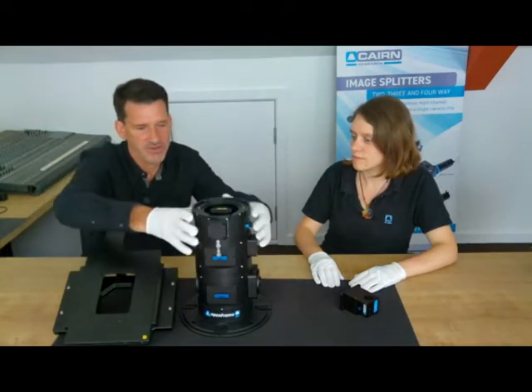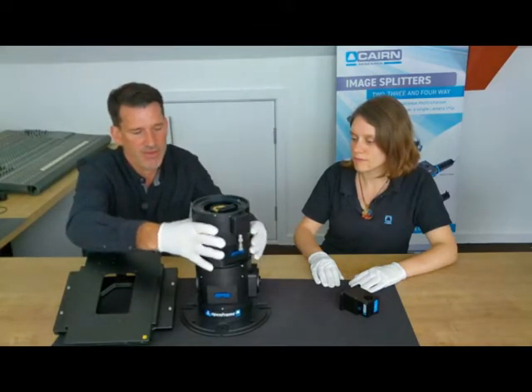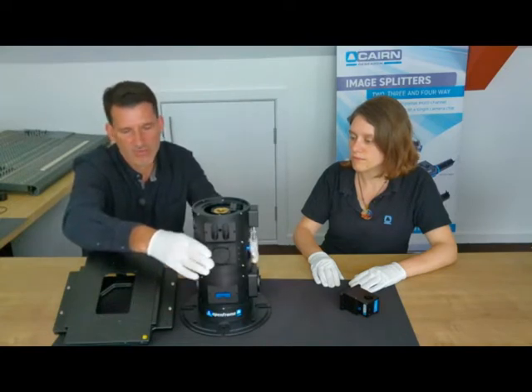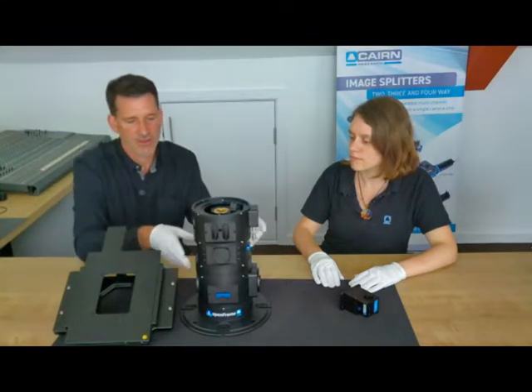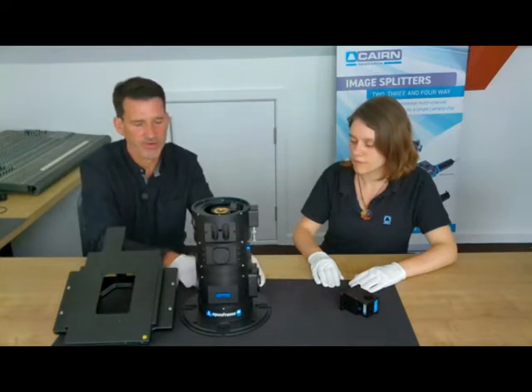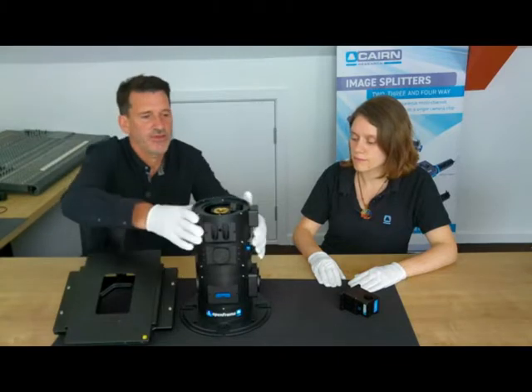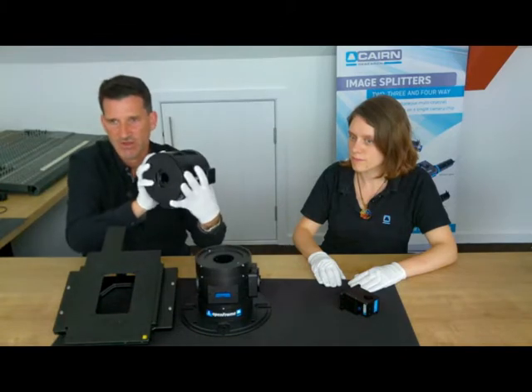One thing that we should have mentioned, or we are mentioning now, is that there is no back or front of the openFrame. So every layer can be orientated in any of preset 45-degree positions, or if you need to do something more esoteric, then the locator pins can be taken out. And below the camera layer, there's a solid base that has mounting holes, both slots and holes to mount onto the optical breadboard. And the central axis of the openFrame is all based around a 2-inch clear aperture.